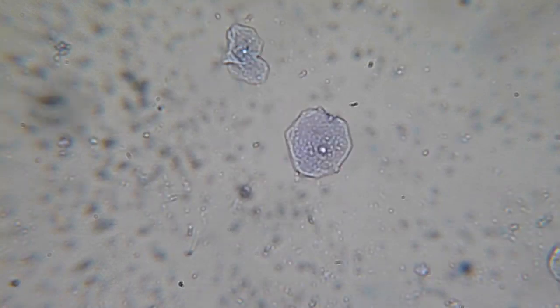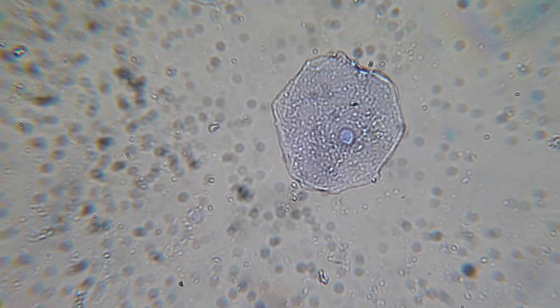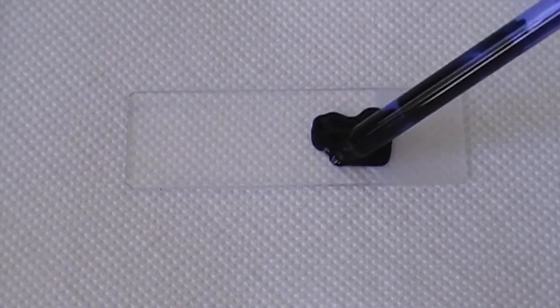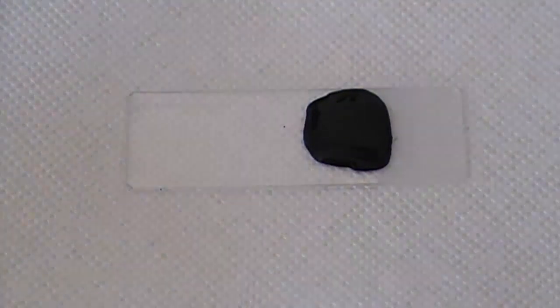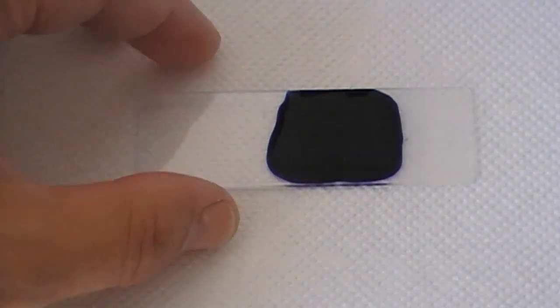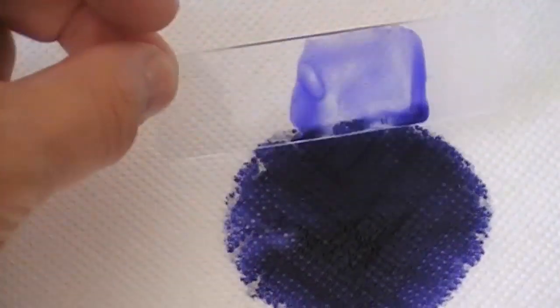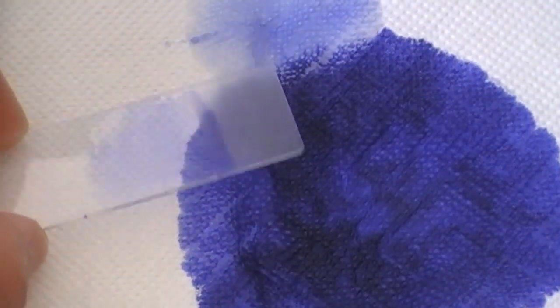You can see the nucleus in the middle. There is a lot of dust in the background over here. I'm going to restain the whole thing and give it another try. I'm just going to add some ink over here on the right side, wait again a few minutes, and reduce the washing time a little bit. I'm going to try a different washing step — just washing it with clear water by dripping it on here. I'll leave it as it is, not completely washed, and we'll see if this works better.